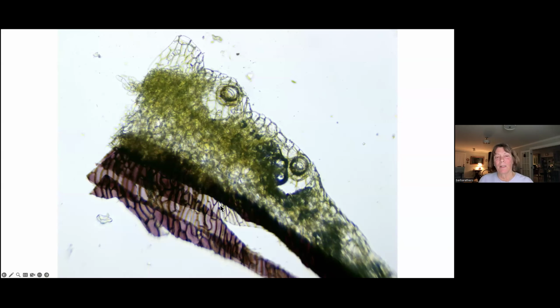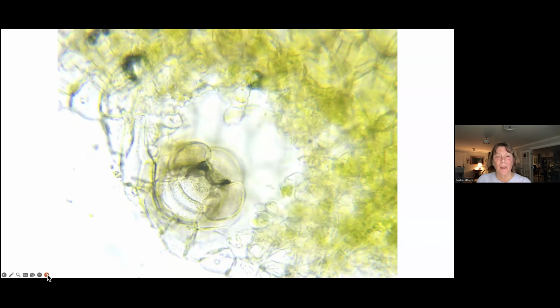Now here's an example. It's a terrible section. It's very oblique, but it just happens to show a key feature for identification, which is the nature of these pores. These are the pores in the upper surface of the thallus that gave it that kind of odd scaly appearance. And I can see right away that they're formed of concentric rings of cells with an open space below. Well, that's a great clue. Even though it's a terrible section, it's a great clue. This is the upper surface, here's the lower section, but it tells me some stuff I need to know. And when I zoom in on that and look down, it looks like there are actually 5 cells in this ring, and this is the pore opening.